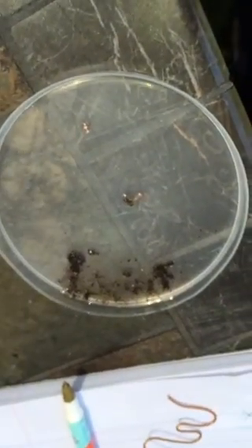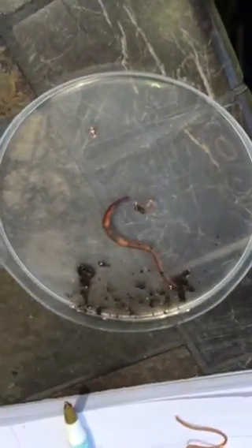Wait, let me show them how small it is. Where's our little worm? I see it — tiny tiny little worm. There he is. That is what we saw in the microscope. And then Brianna got a bigger worm — you should use this one next!